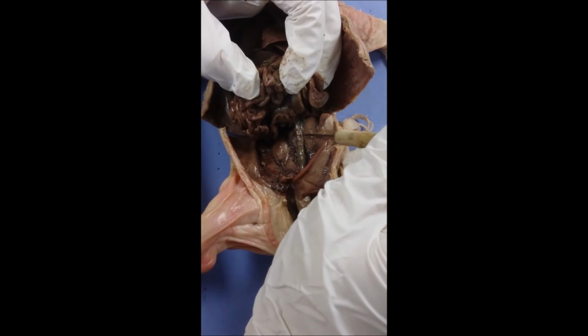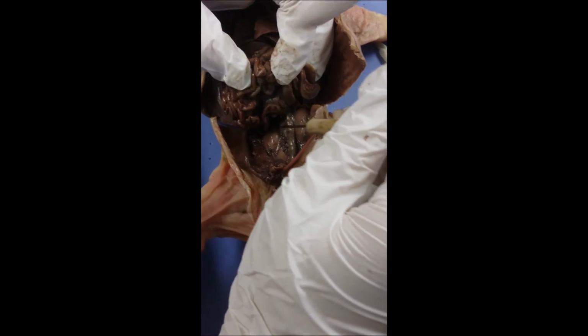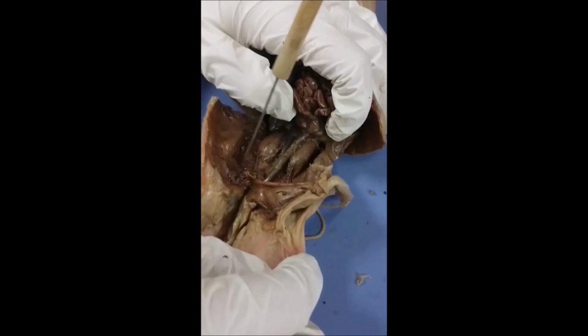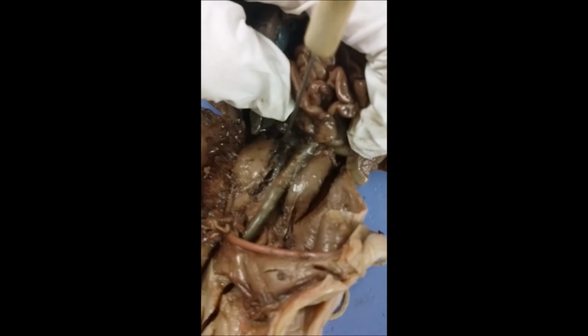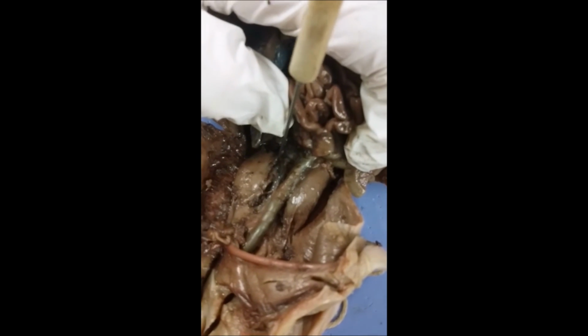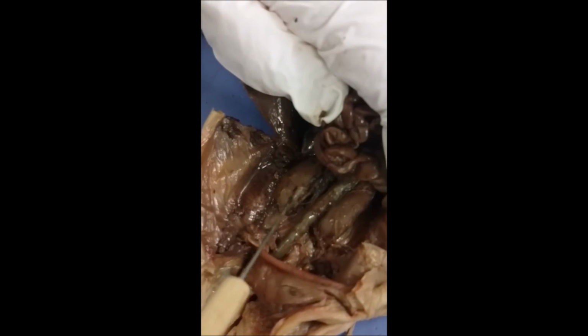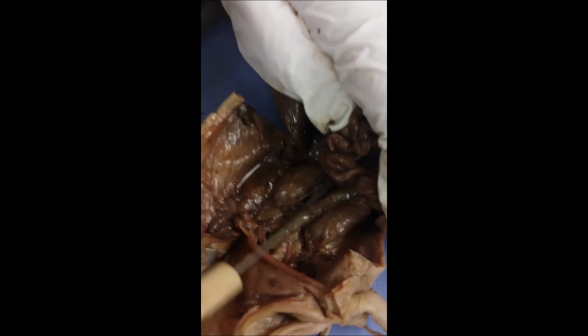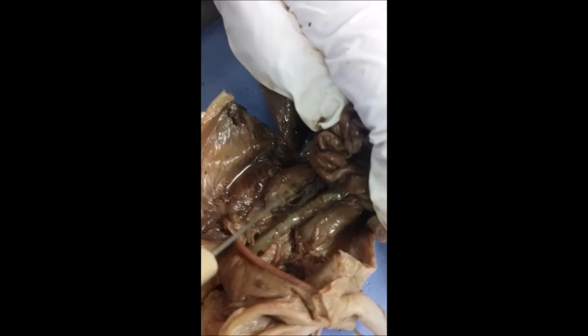Okay, so there's an artery that connects the kidneys and helps supply blood to them, which are down there. A short tube coming off the kidney is the renal vein. So you point it out, right? The two kidneys have two functions and are located right below the diaphragm.